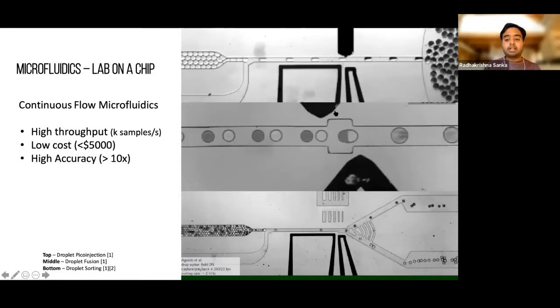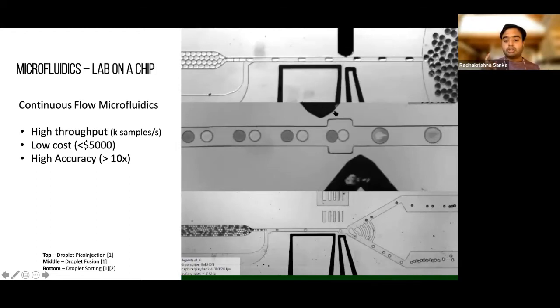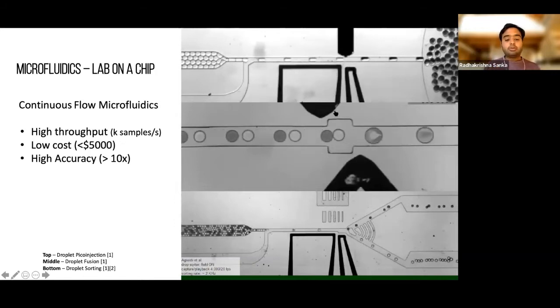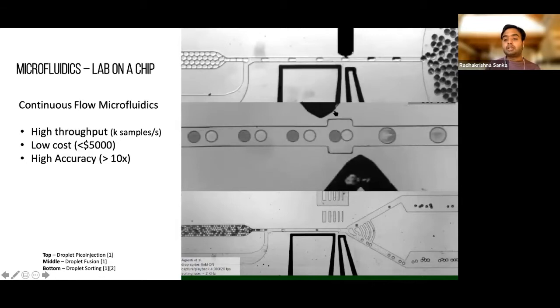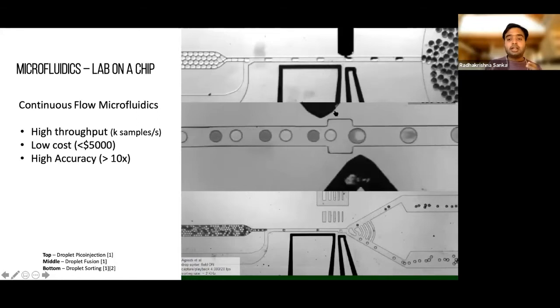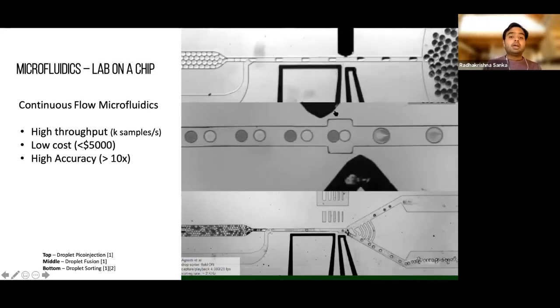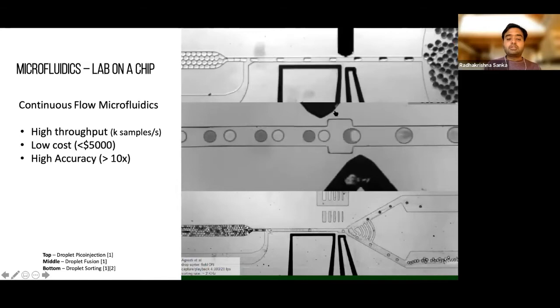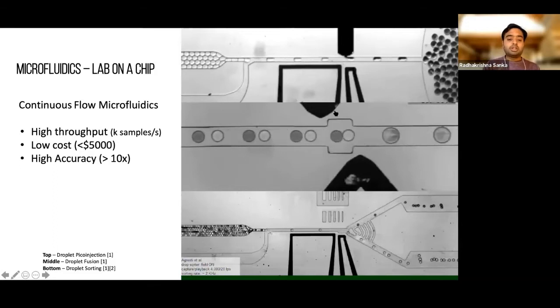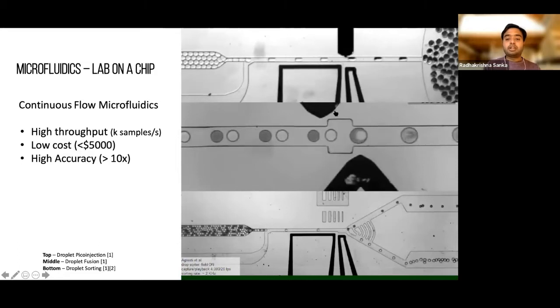And the third one is where you're selecting between two different droplets. As you can notice in the video, the ones flowing on the top column are dark droplets, and the ones going at the bottom are the light ones. Now, one of the most interesting things about droplet-based devices is that you could process 1,000 samples a second. And these videos you're looking at are actually slowed down by 200 times, 400 times. And that is insane, because instead of doing one experiment at a time, where you're pipetting each and every test tube, you can mass produce and process all these samples in a large scale setting.